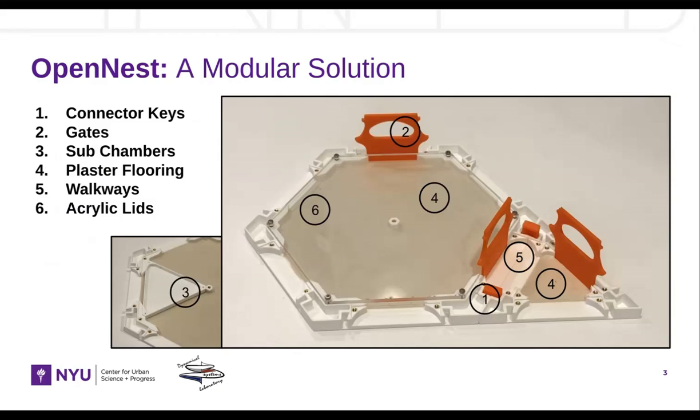OpenNest is our modular solution and provides researchers with a toolbox to build unique and effective experiments. The environment is made up of three chamber sizes, which can be fitted together to form unique geometries with an acrylic lid for top-down observation. OpenNest has six ingredients. Through our presentation, we will highlight the unique features of the nest and then demonstrate two potential uses for the build.